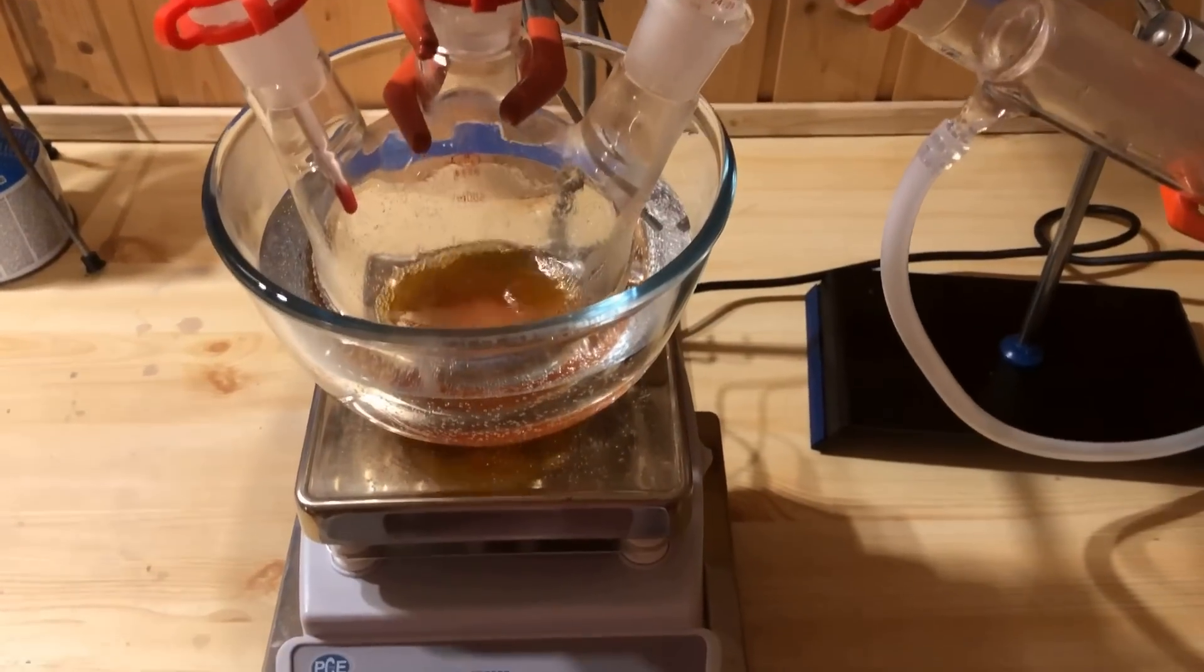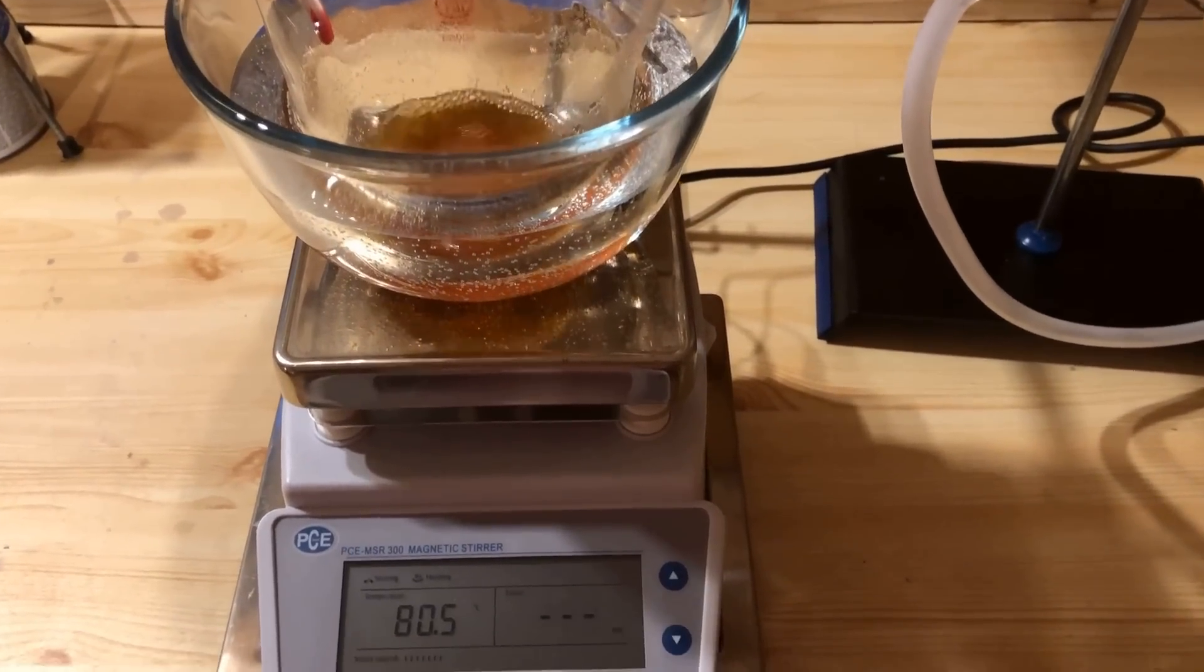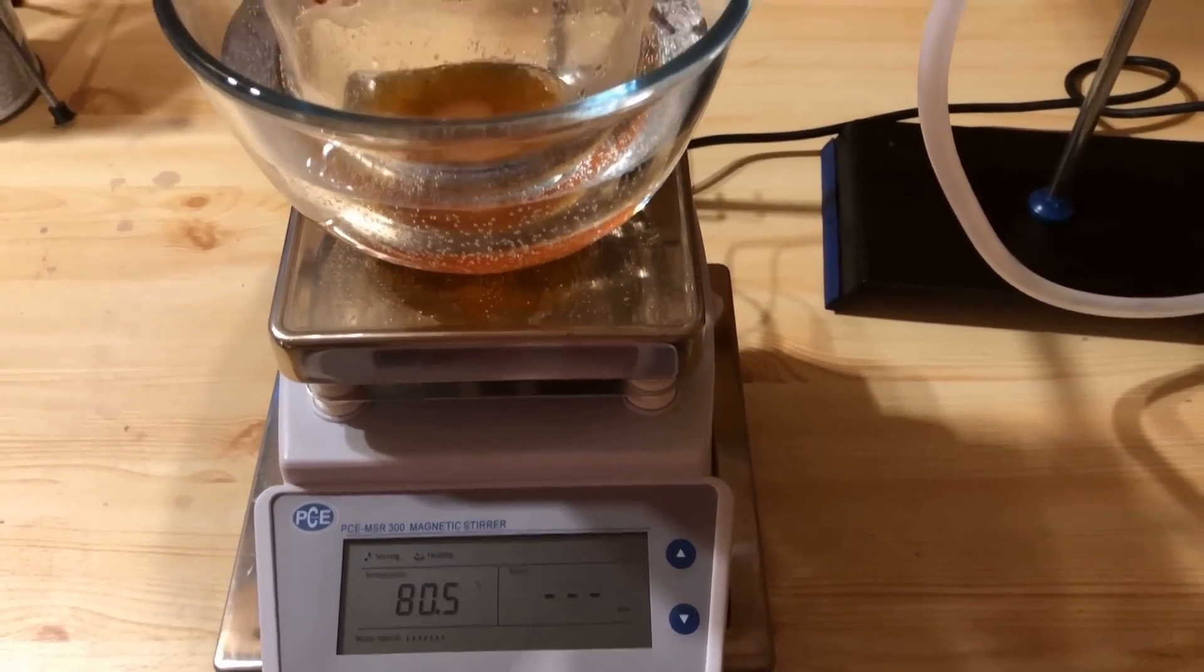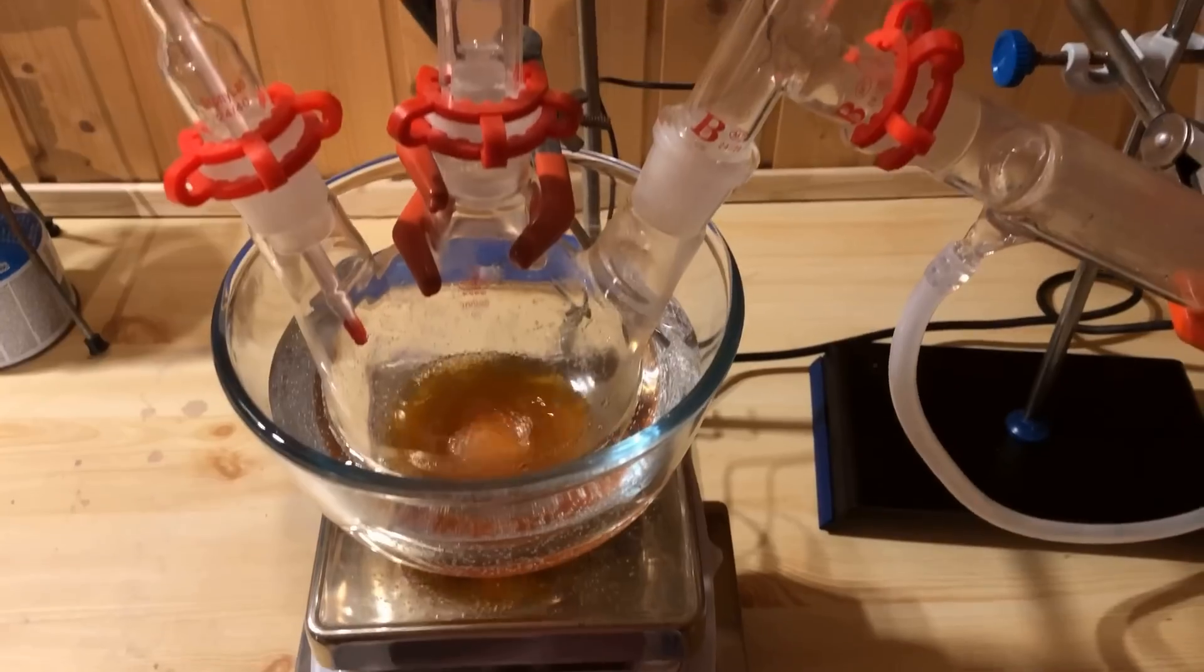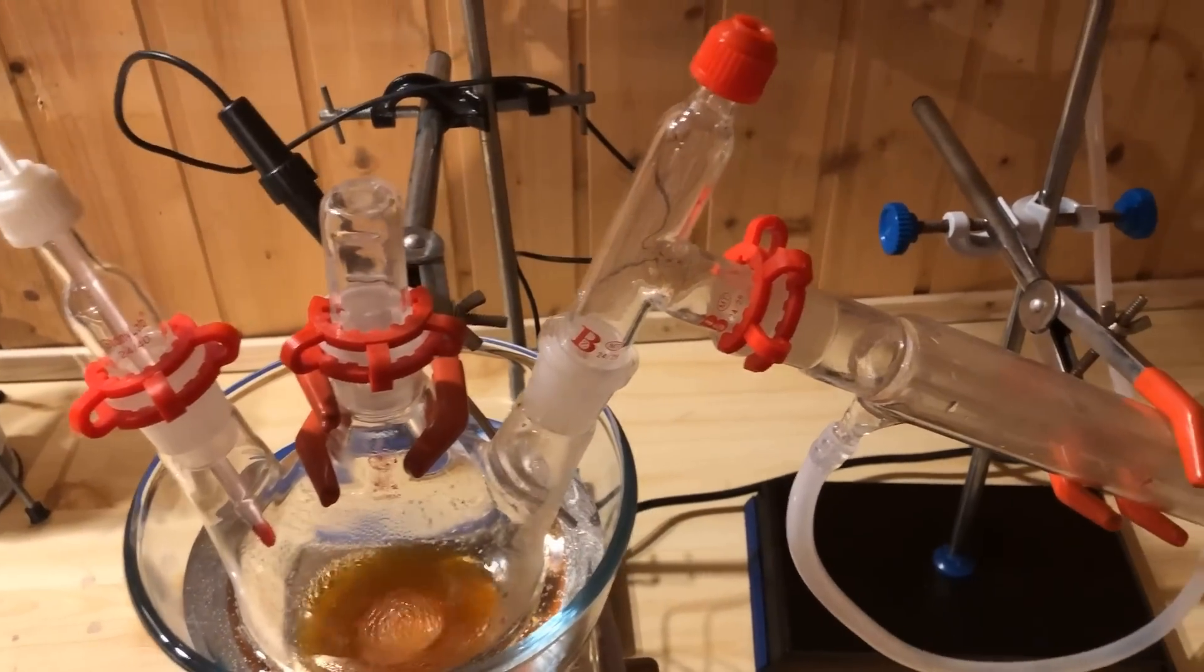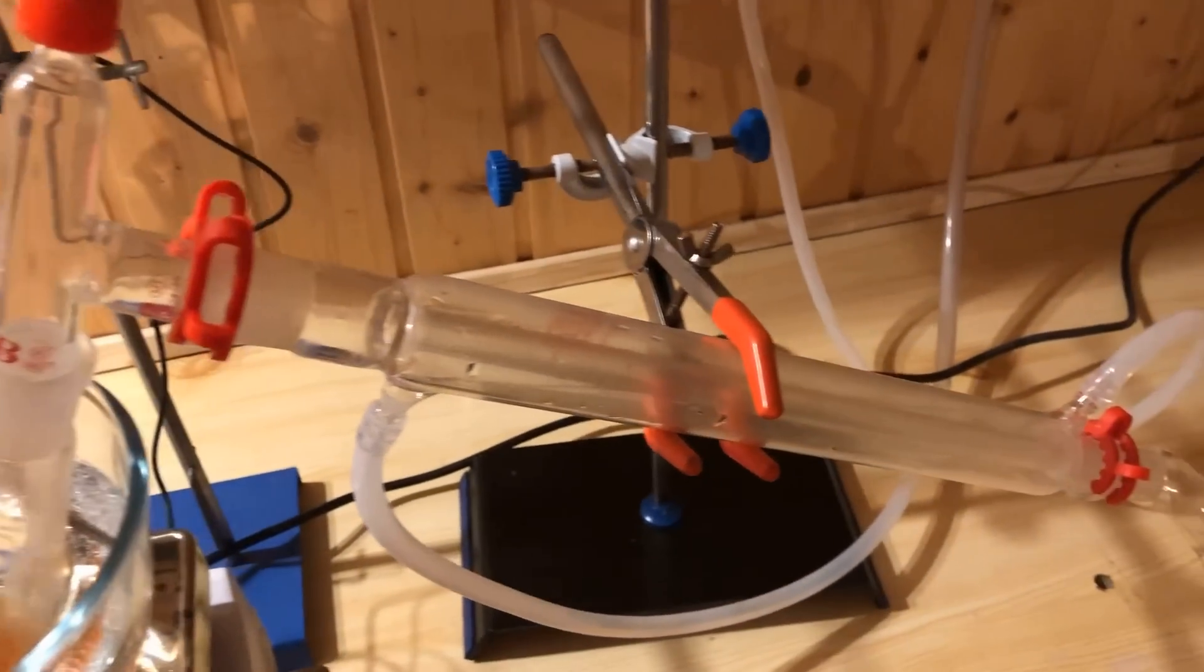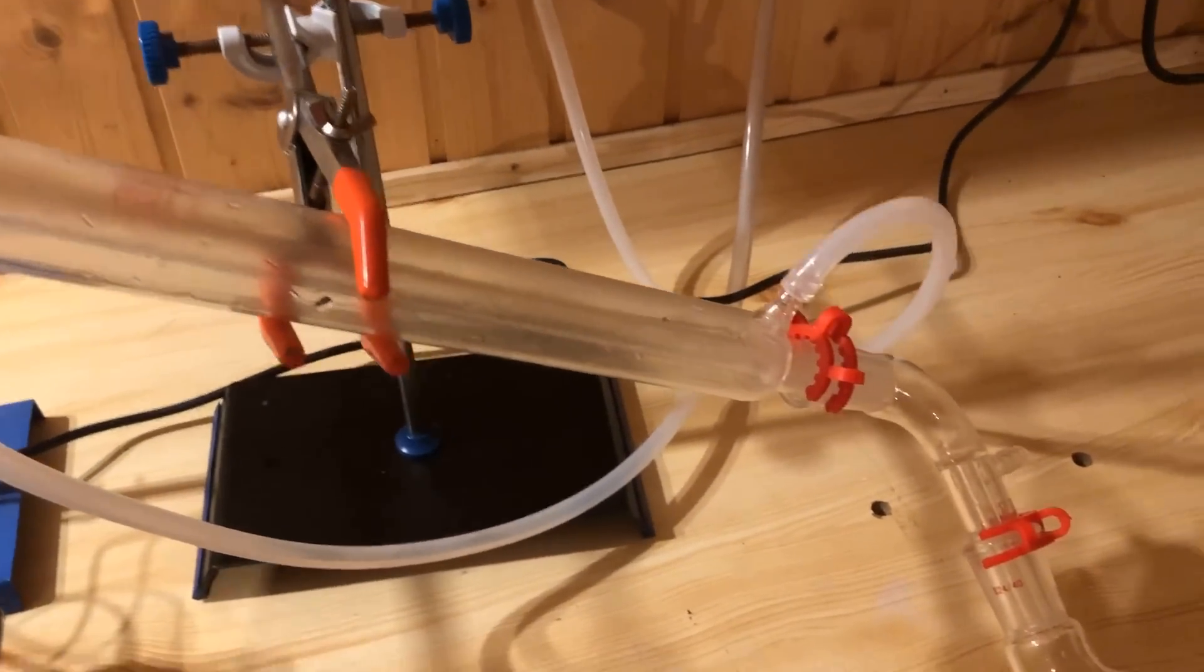To further purify the crude benzene, a water bath distillation is then performed. The temperature of the water bath should be slightly above 80 degrees Celsius, as the boiling point of benzene is 80 degrees Celsius.